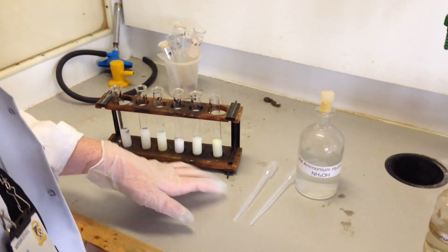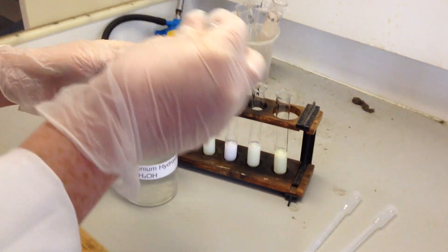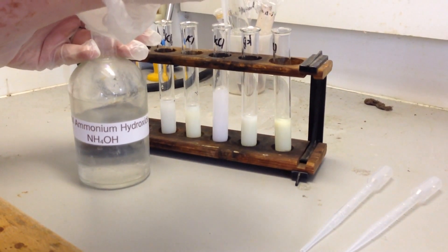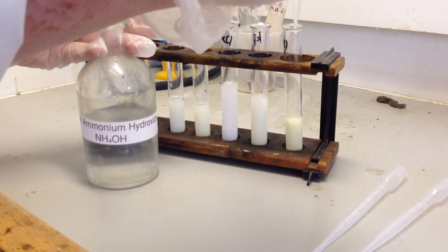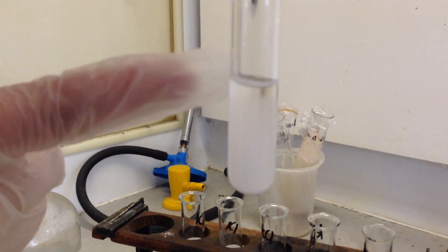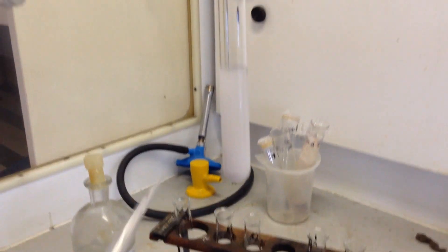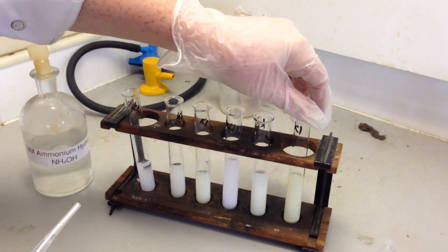So to confirm the identity of these ions, I'm just going to add some more concentrated ammonia solution and we will see what happens. Hopefully what you can see is that the white precipitate has actually gone clear at the bottom — that's because it has re-dissolved in the ammonia solution. This one has dissolved a bit but you can't really see it. And the precipitate here shouldn't dissolve at all.